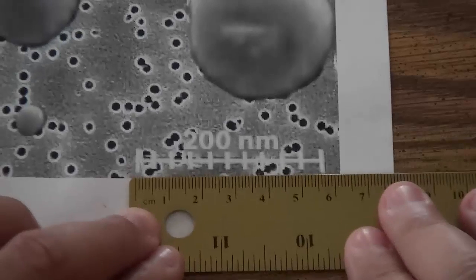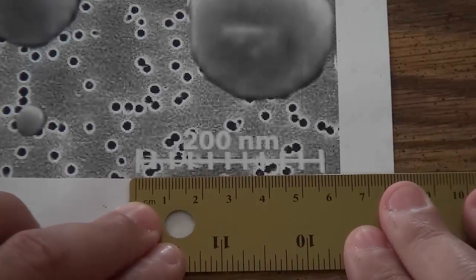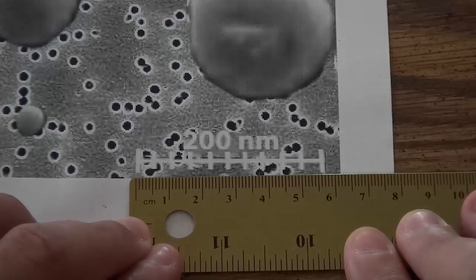Measure the scale bar with a ruler and record the value. For our example, the scale bar is measured at about 5 and a half centimeters.